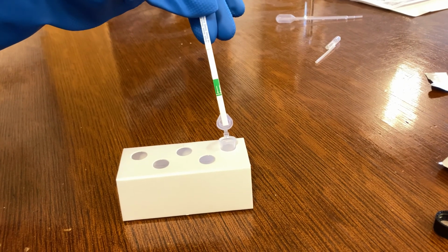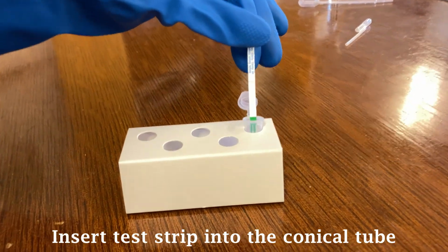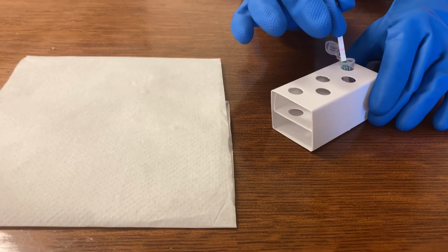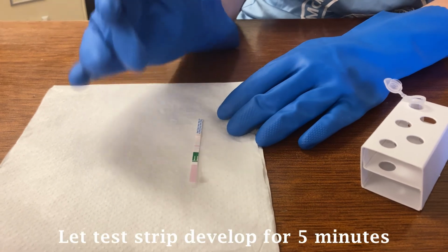Next, we inserted the test strip into the conical tube with the arrow pointing down. We then let it incubate for 10 minutes. Afterwards, we removed the test strip and laid it flat down and allowed it to develop for 5 more minutes.